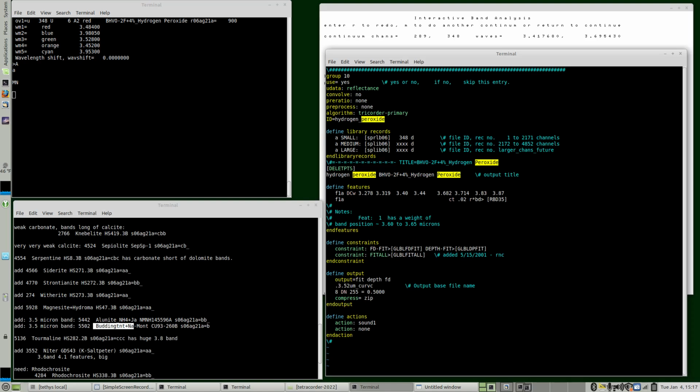we call it something like ammonium dash, and this is actually a buddingtonite montmorillonite. That's what the mont is here. We could leave that off completely, or if we're putting in a number of ammonium compounds, it's a good idea to make it unique so that we can identify the reference material just by looking at the file name on an output file.